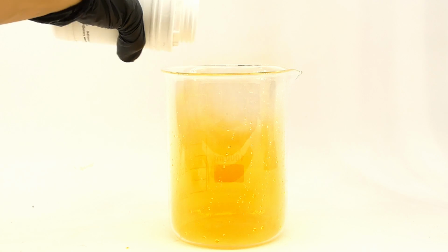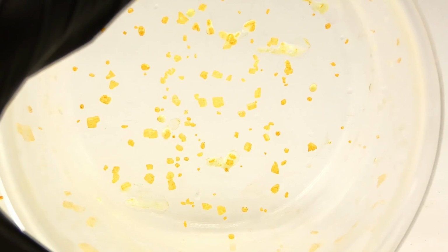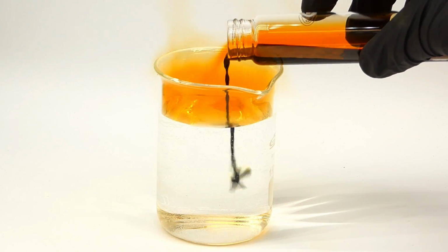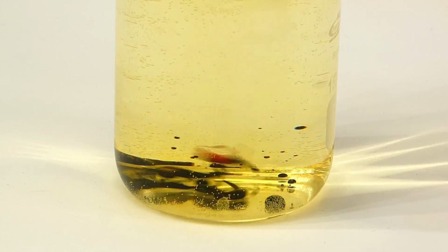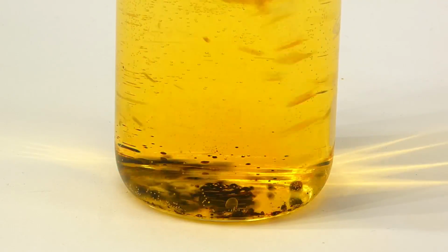Also, to easily neutralize bromine or its vapor, a chemical called sodium thiosulfate can be used, which reduces the bromine, making it way less dangerous, and you can see this in action in this beaker. It's worth noting, however, that this produces small amounts of elemental sulfur that can be a nightmare to remove from glassware. Another interesting property of bromine is that it can dissolve in water to form this orange liquid that in some cases can be used as its substitute. It also dissolves readily in organic solvents, and this form is often considered to be a little bit safer to work with than pure bromine.